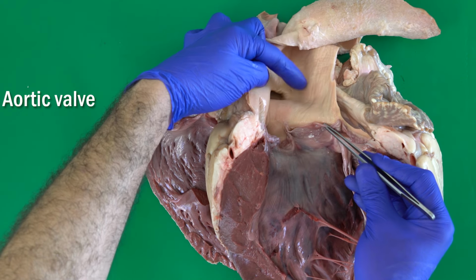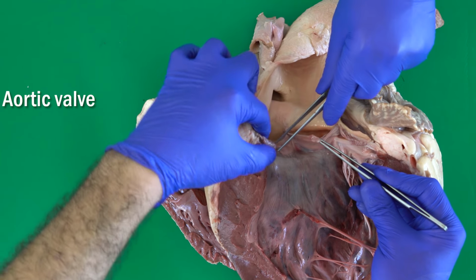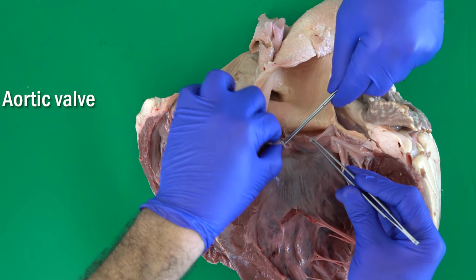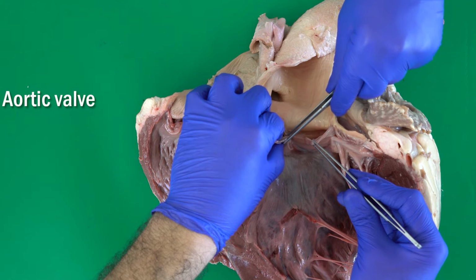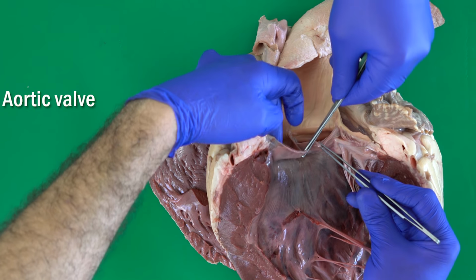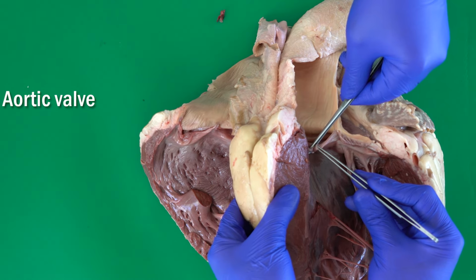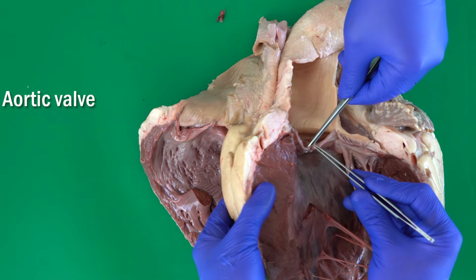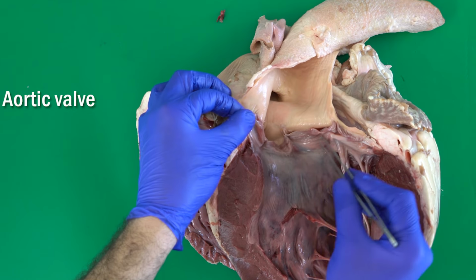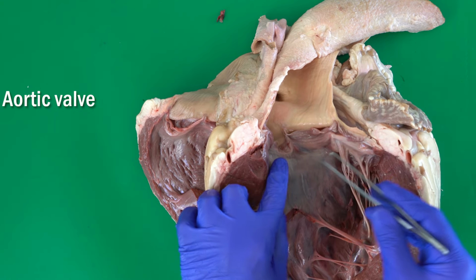After that, if the blood wants to go back, the blood will fill these valvulae completely, and this will close the opening between the left ventricle and the aorta. So what is the name of the valve between the aorta and the left ventricle? The aortic valve.